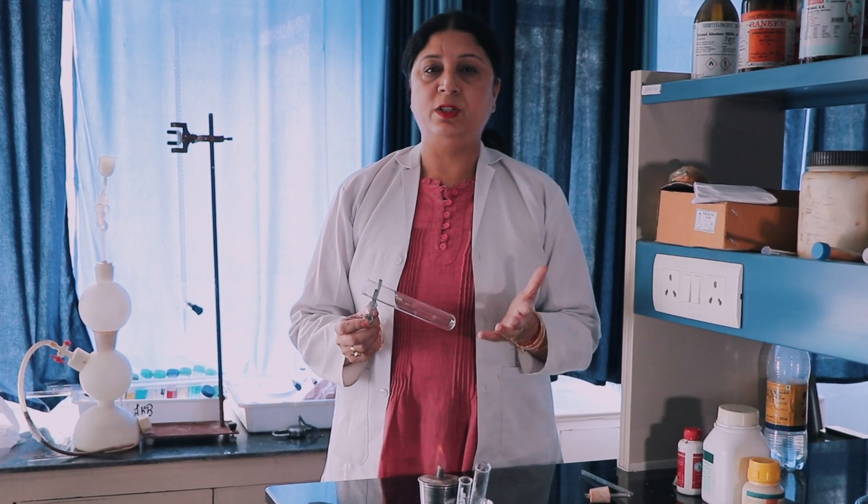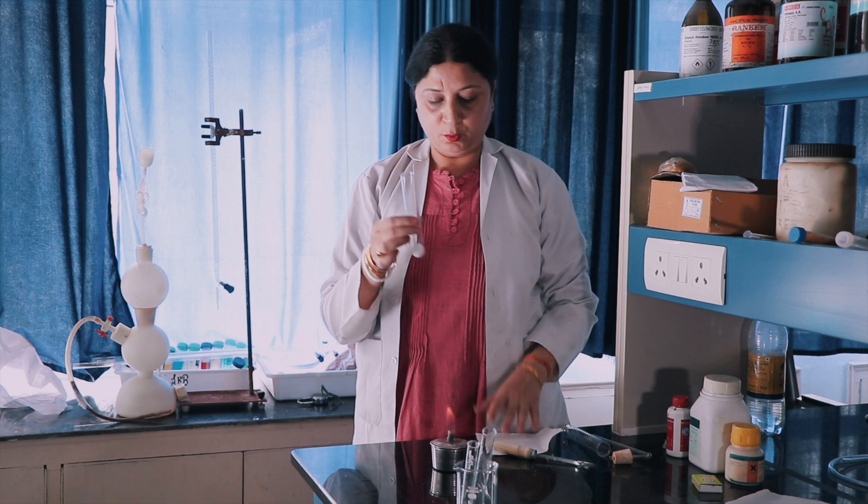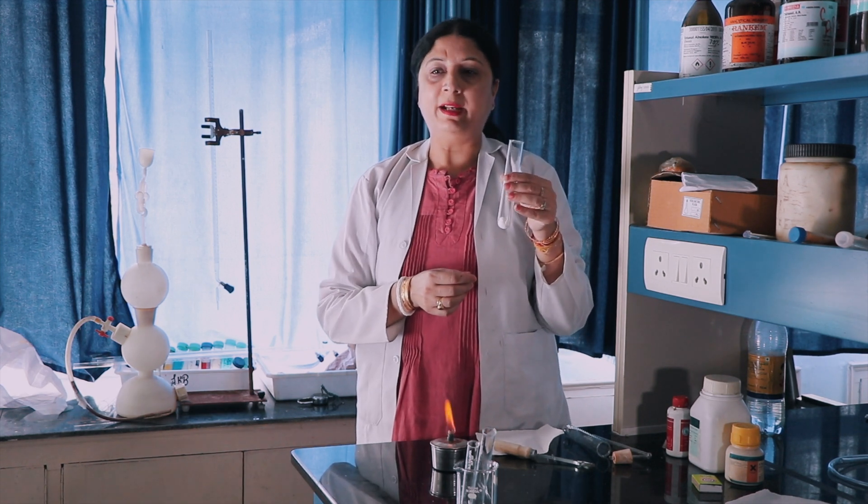First of all I will explain thermal decomposition, which means decomposition of a substance in the presence of heat. For this I am taking lead nitrate crystalline solid. This is a hard dry glass test tube and I have taken a small quantity of lead nitrate.